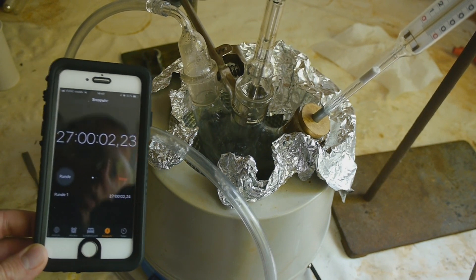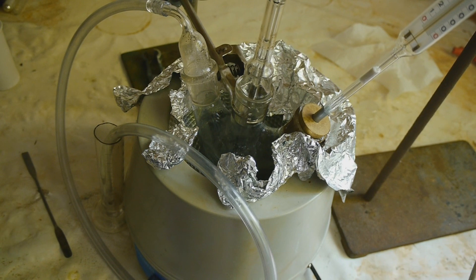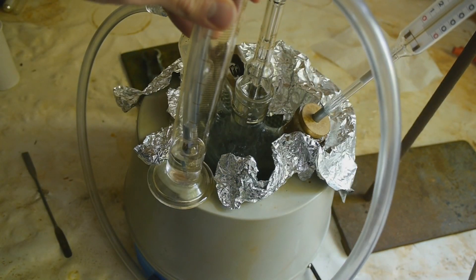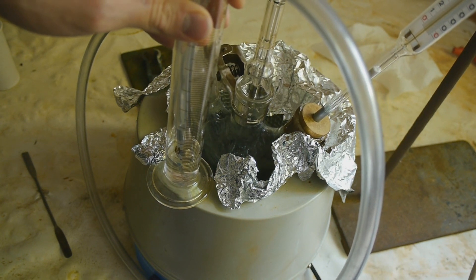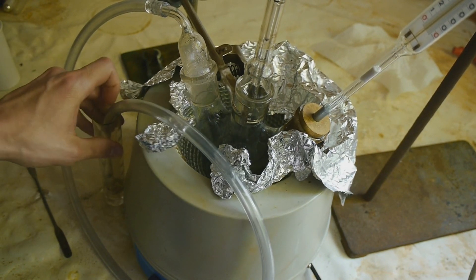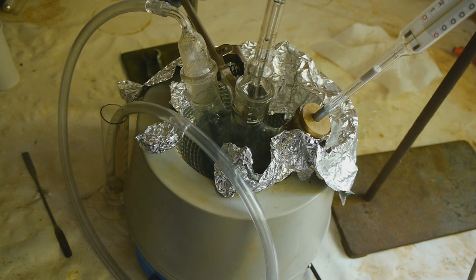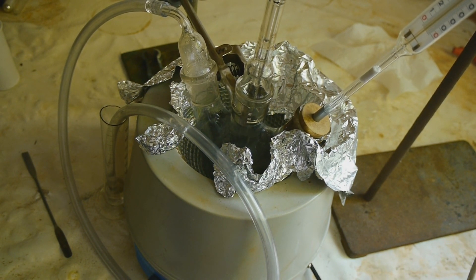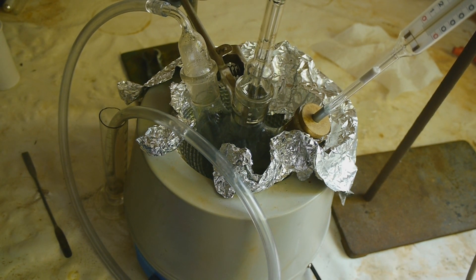We are pretty much at exactly 27 hours reaction time now. And I've seen that the bubbler is starting to backflow, which is indicating that the reaction is done. We are 210 degrees inside the reaction mixture, so I doubt that it's too cold for the reaction to continue. So I will turn off the heat right now. Stop the stirring.